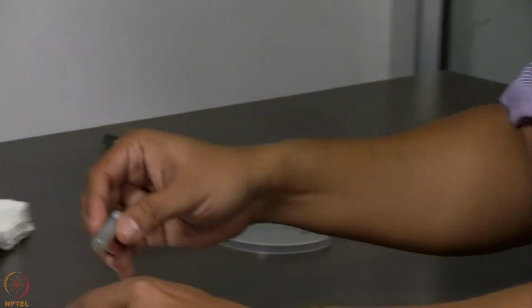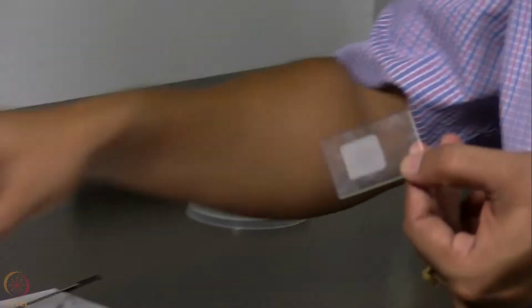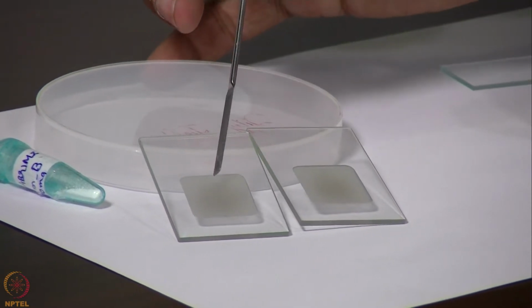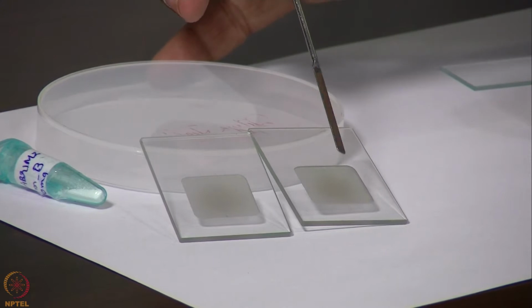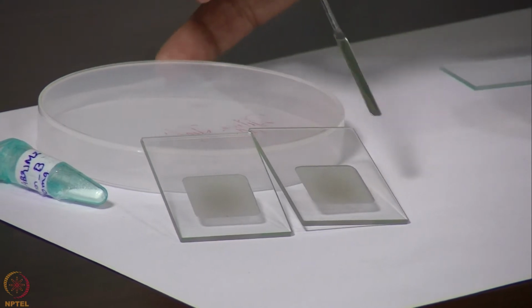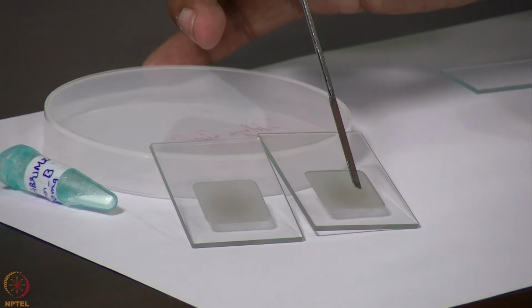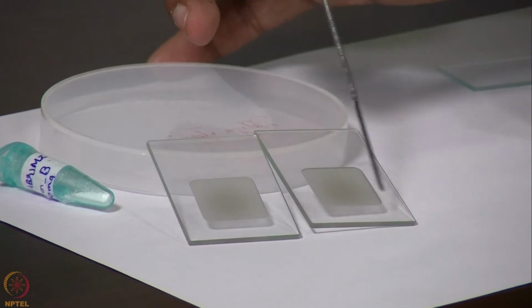Once we have powdered a sample using this mortar and pestle, we need to transfer it to these sample plates. These are the sample plates on which we need to spread our samples. You can see that the central region in these plates is etched, and these etched plates have different depths. Depending on the amount of sample that we have, we should choose a particular sample plate so that we fill the entire groove with our sample. These plates come with different depths, like 0.1, 0.2 and 0.5 millimeter depth, and the size is about 1.5 centimeter square.